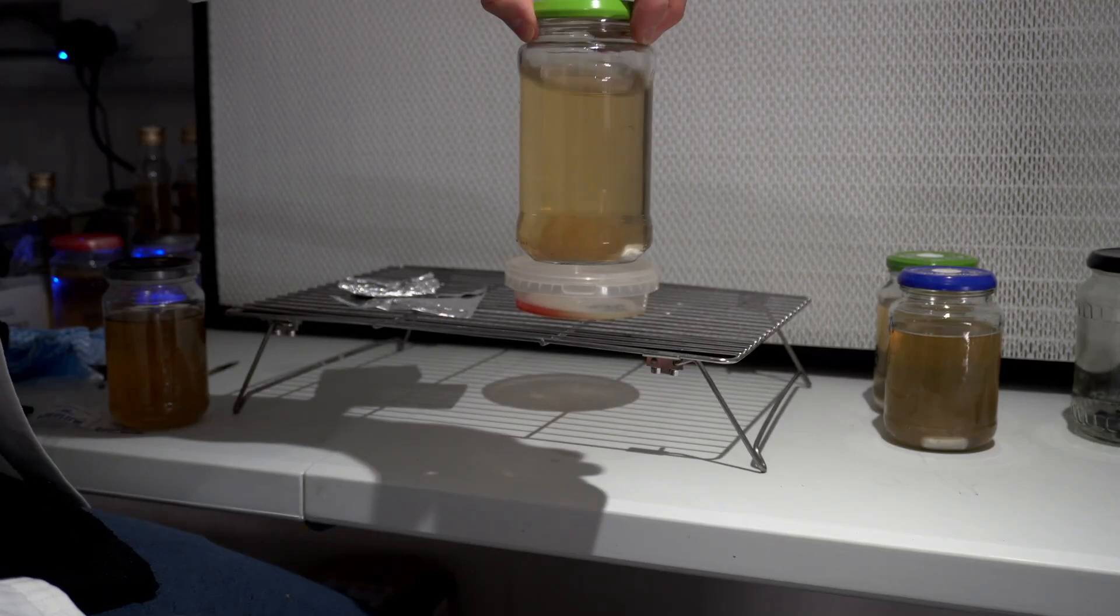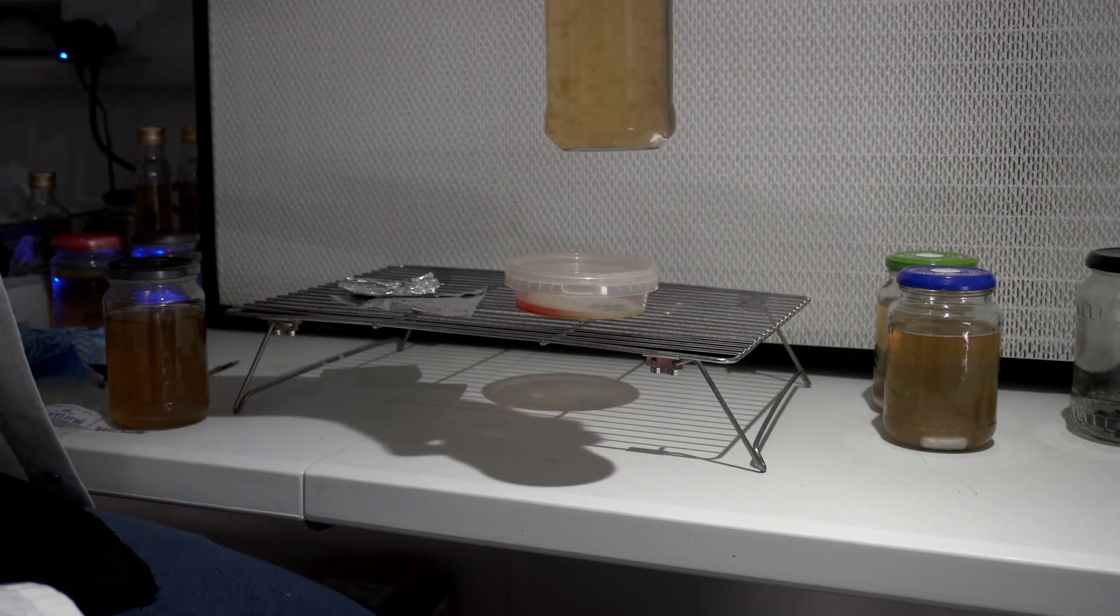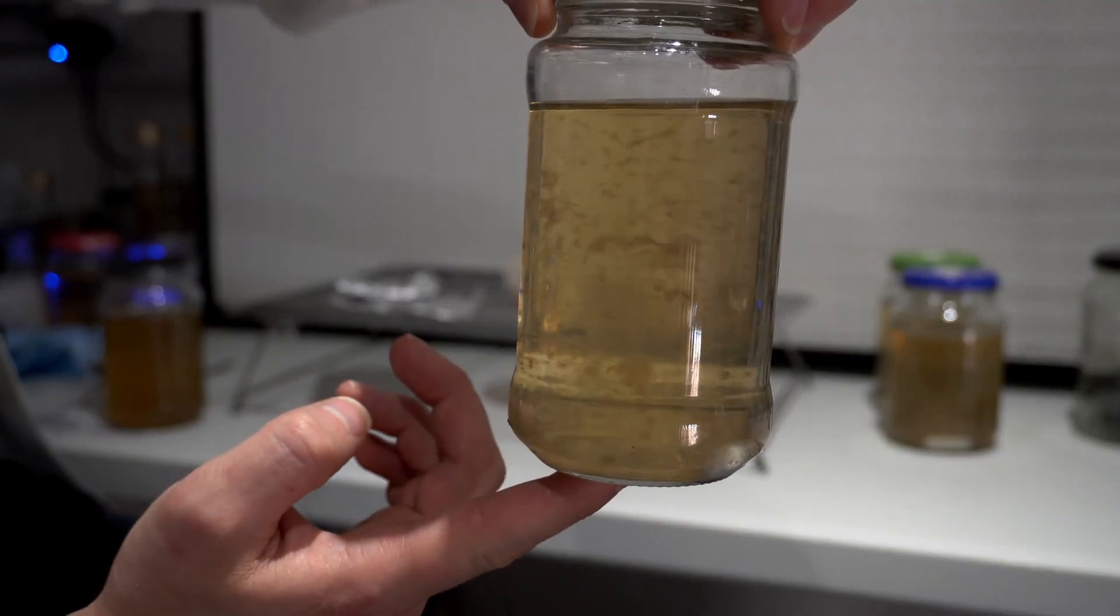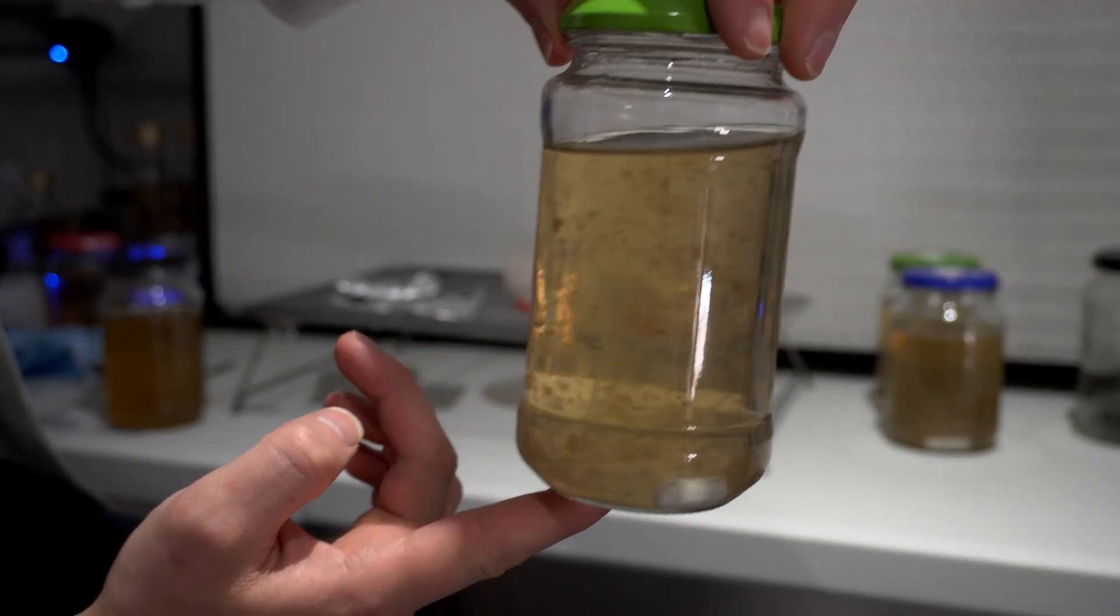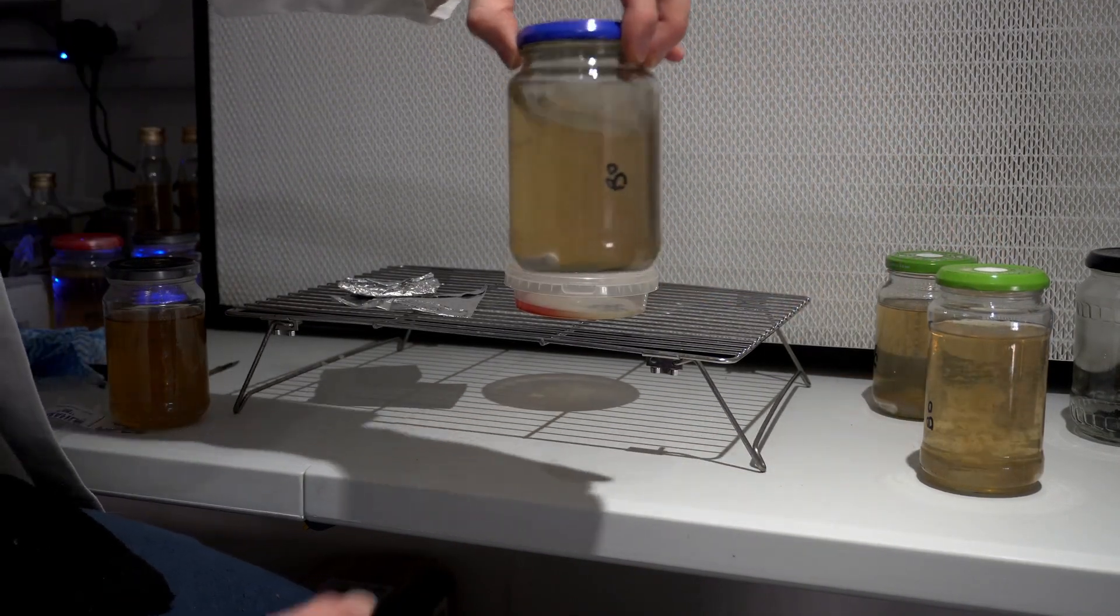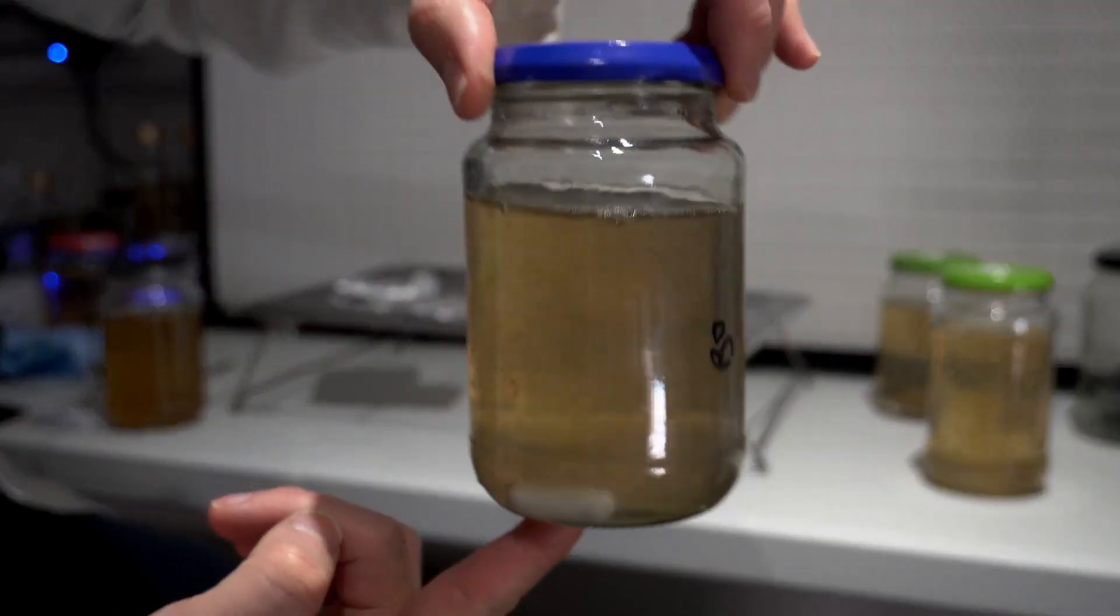Two points I want to get across. First, spore prints are never sterile, so there's always going to be a little bit of contaminant in there and you might have to do some cleanup work, which would just involve doing agar transfers until you get a clean culture.